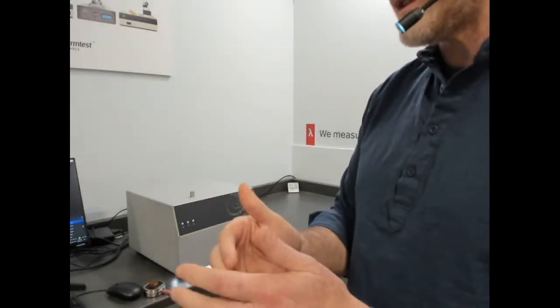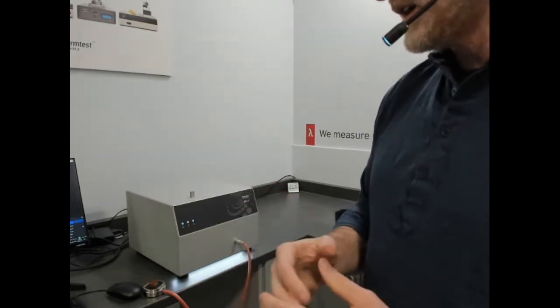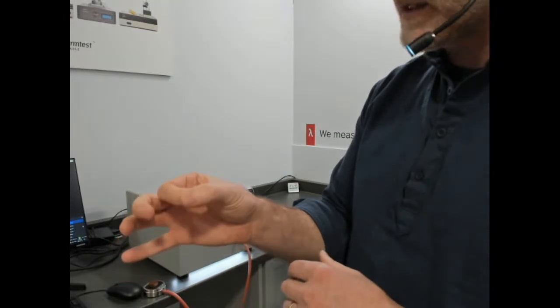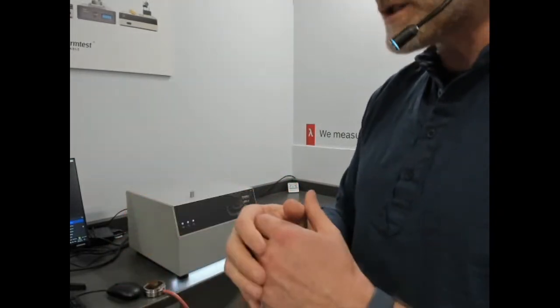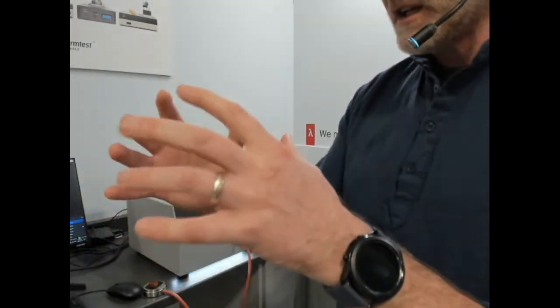it's very important that we satisfy this unitless range called total to characteristic time. What the ISO is describing is that we want to measure a three-dimensional shape. So if your sensor is sitting in the center of a sample that is at least 2 times the diameter, and you're satisfying the minimum penetration, the shape of the heat diffusion inside it, if you visualize, is three-dimensional.